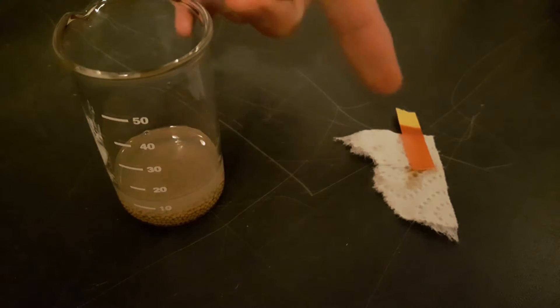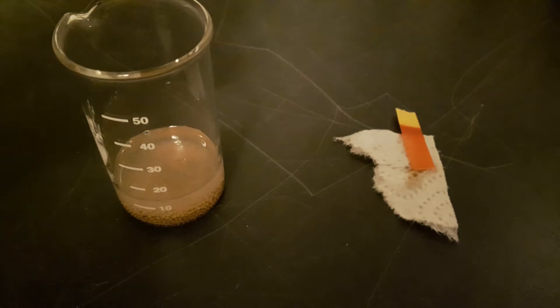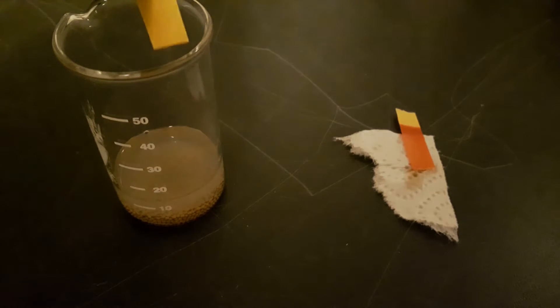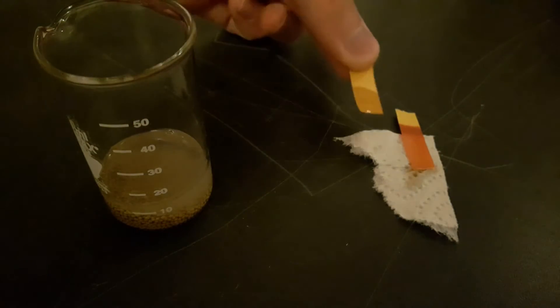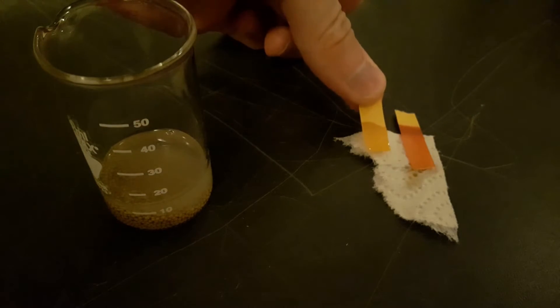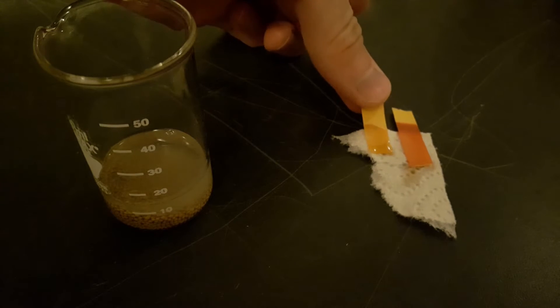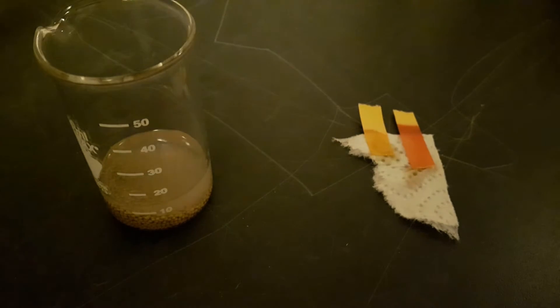Although the solution got cloudy. So, here you see it 5 hours later, and the right pH bar is a reference from the acetic acid I bought.